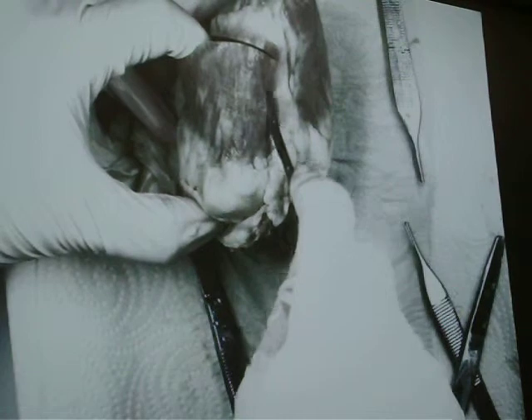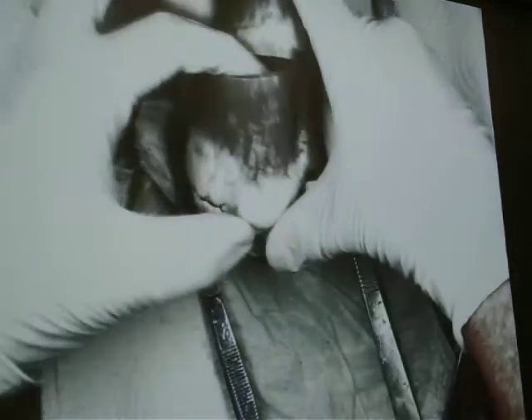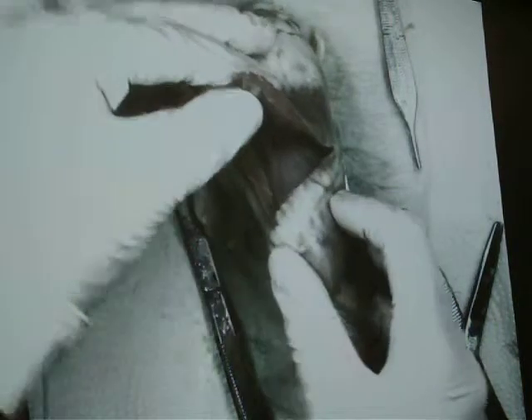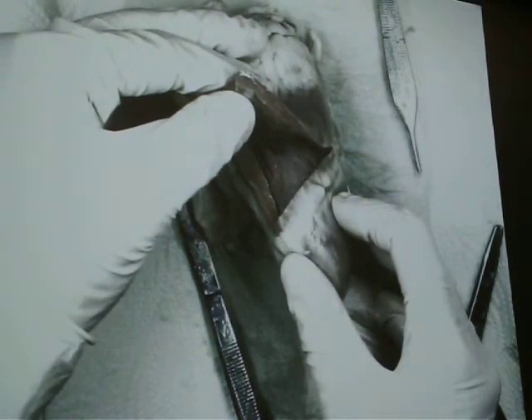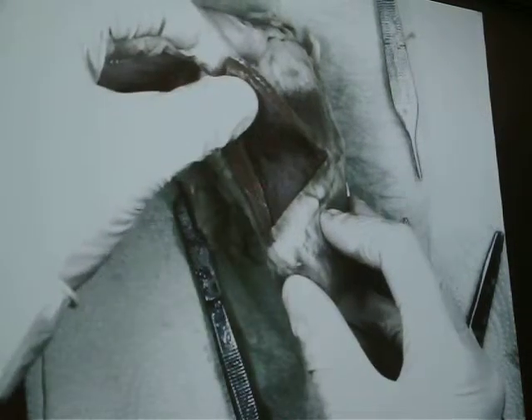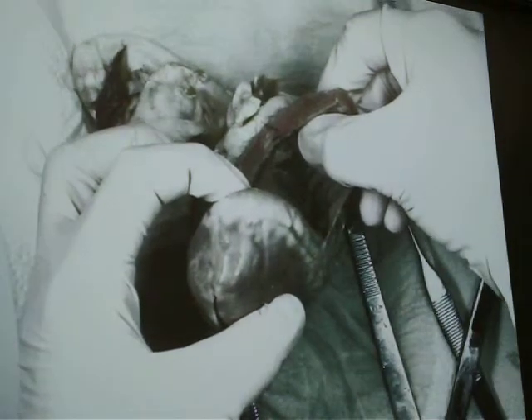I'm going to cut myself — there's my hand here. Her hand is smart; this is smart. See, it started to get into the right ventricle. See how thin-walled that is compared to the other side. And I'm going to keep going up on this side. If you look way down in there, you can start to see that we're getting into the valve.